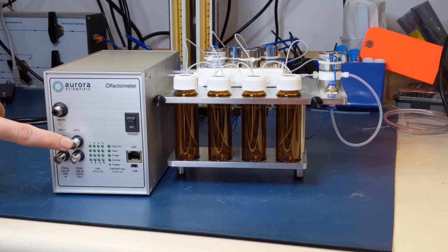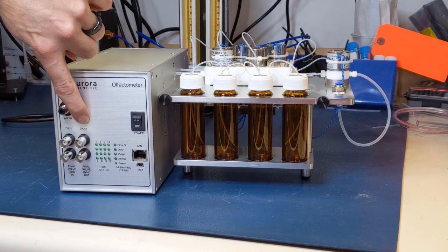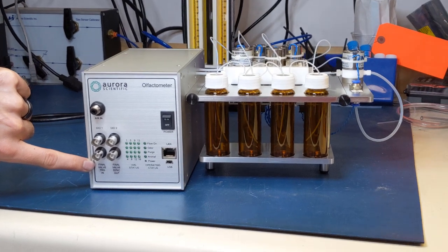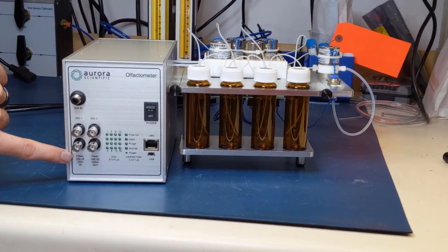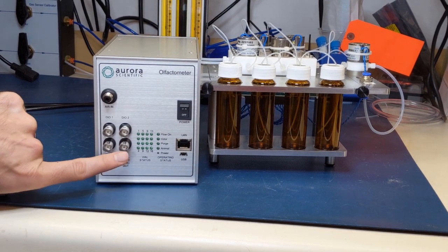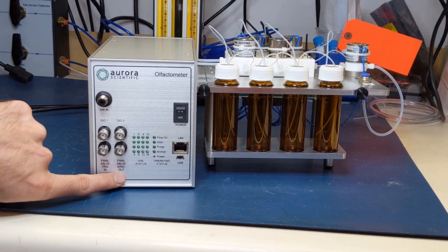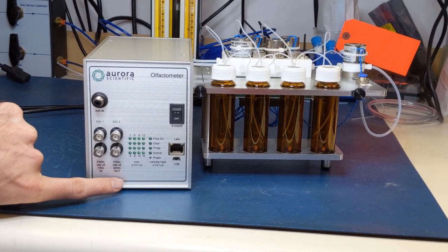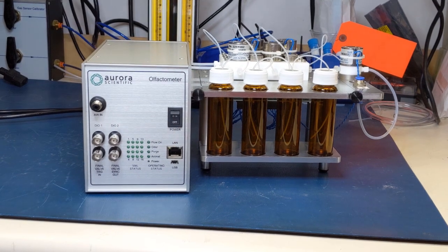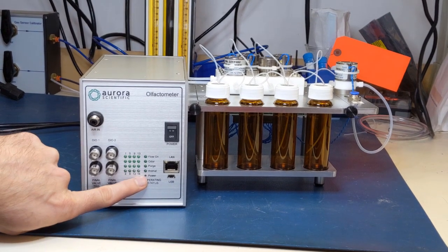Beside that is DIO2, which is an output configurable by the user to generate a sequence sync out or vial status signal. Below that is final valve trigger in, which takes an externally delivered TTL signal to trigger the opening or closing of the final valve, where high opens the valve and flows the odor into the animal and low closes the valve and flows the odor to exhaust. Next to it is final valve sync out, which generates a signal corresponding to the final valve status where high is open and low is closed. Control of the olfactometer is done via an Ethernet cable connected to the LAN port. The front panel power switch turns the unit on and the power LED will illuminate, indicating that the unit is now powered.